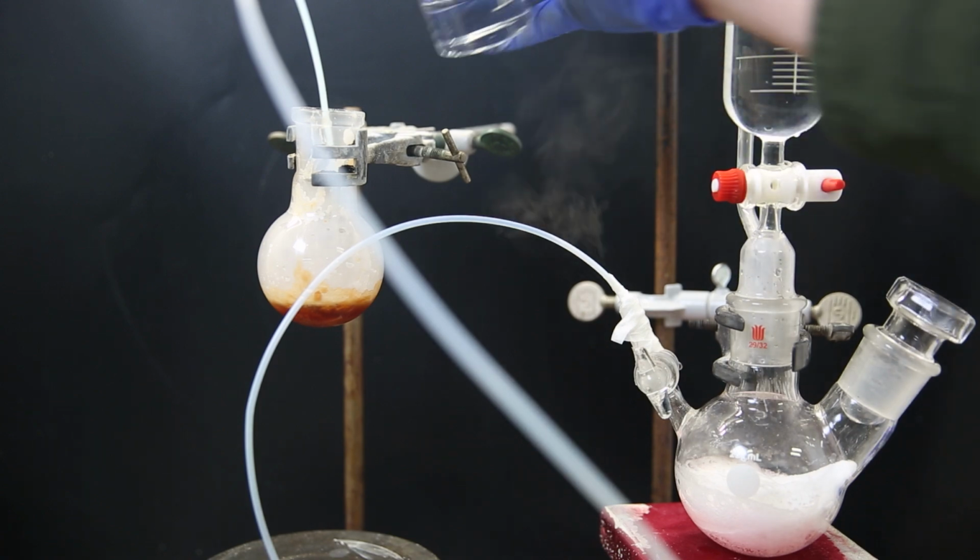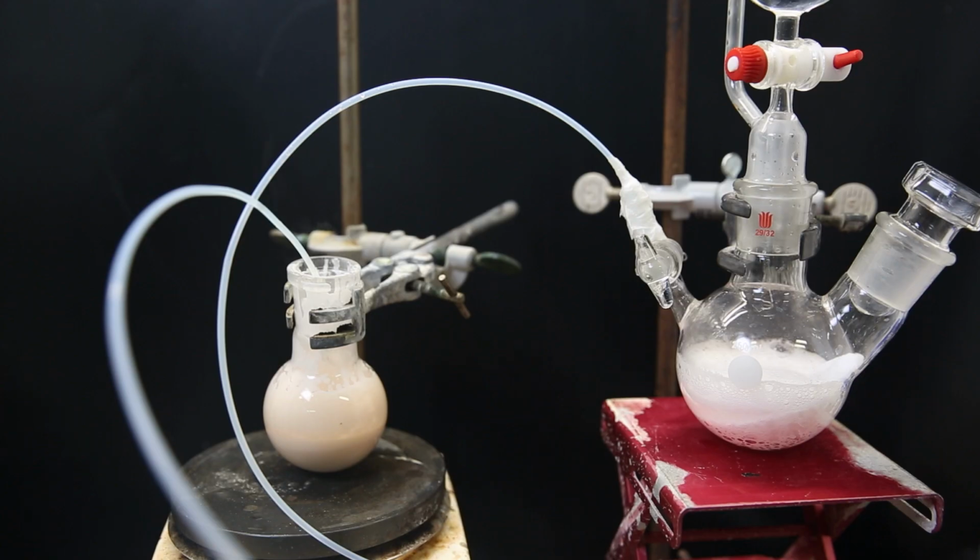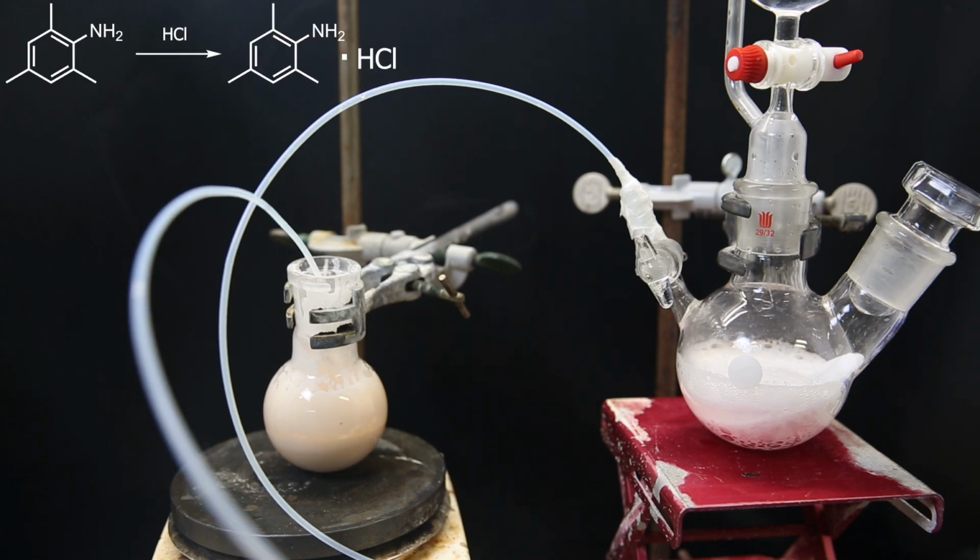So in the end, I settled for dissolving the mixture back into ethyl acetate, stirring it strongly, and blowing the hydrochloric acid gas on top. This worked very well, and a lot of the salt precipitated out quickly. The full setup is just a flask with a gas connector that contains some sodium chloride, and a dropping funnel with concentrated sulfuric acid on top. The hydrochloric acid is then produced by adding some of the sulfuric acid.